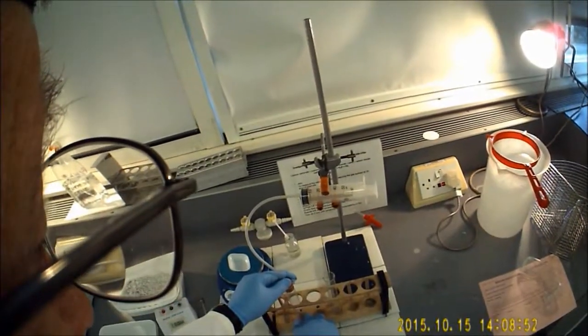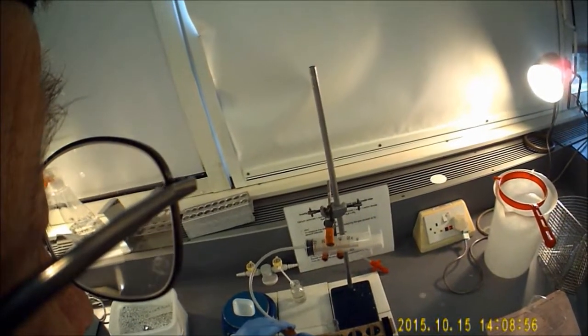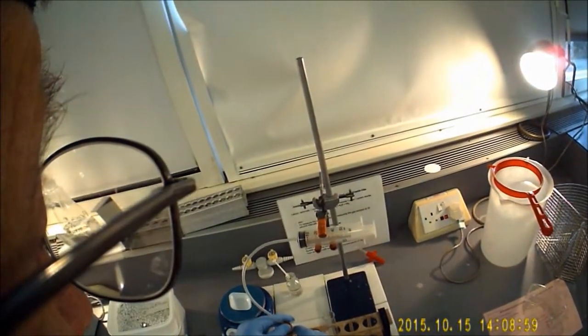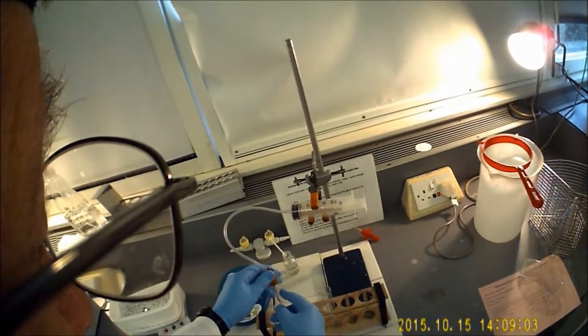The gas is produced by the reaction between hydrochloric acid and the calcium carbonate, and carbon dioxide is produced which will build up in the boiling tube.